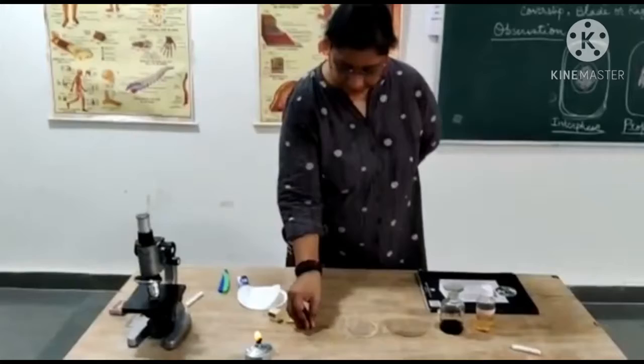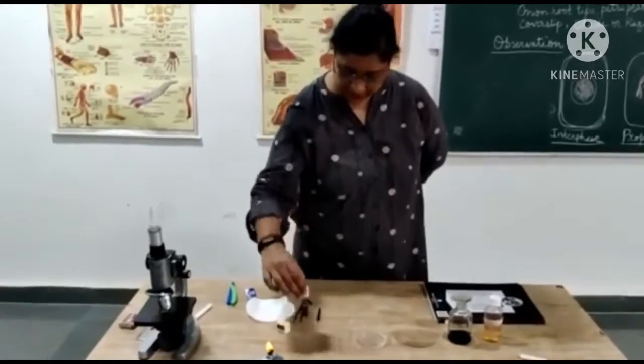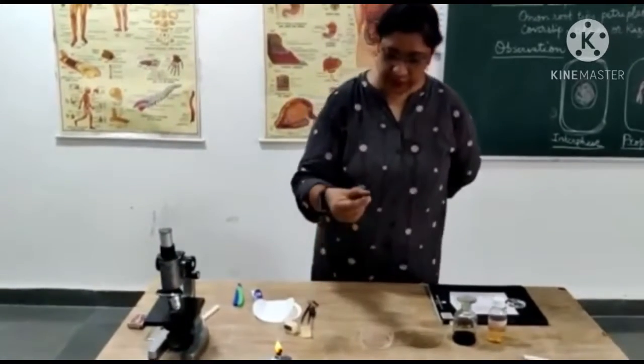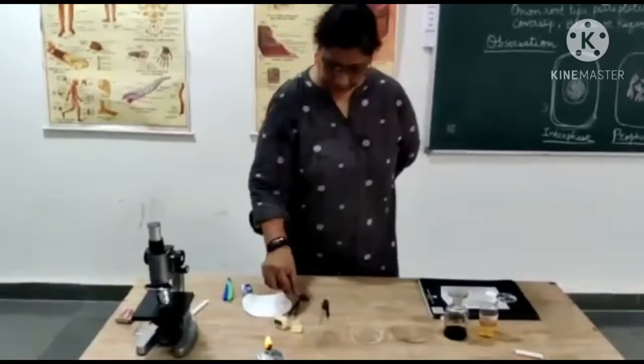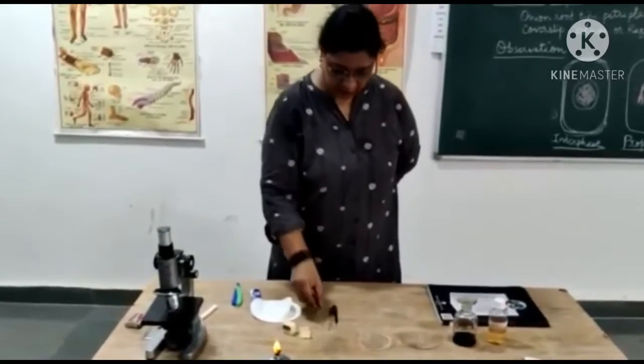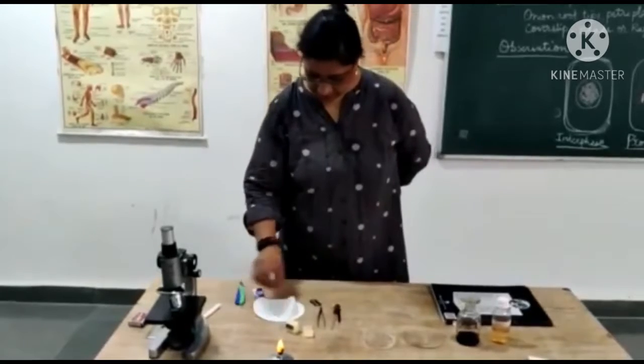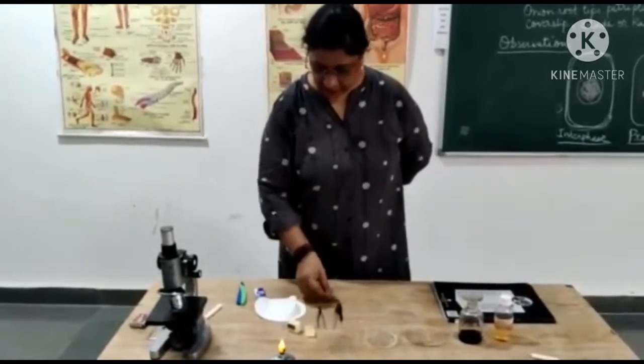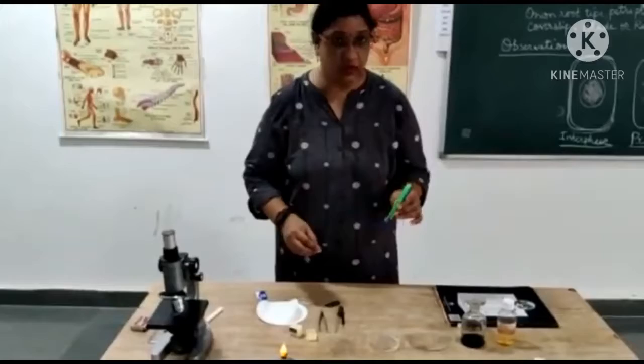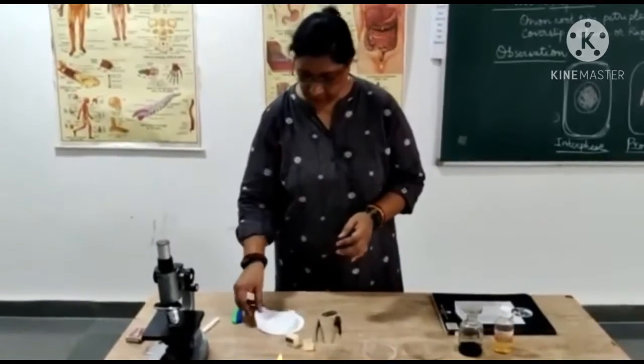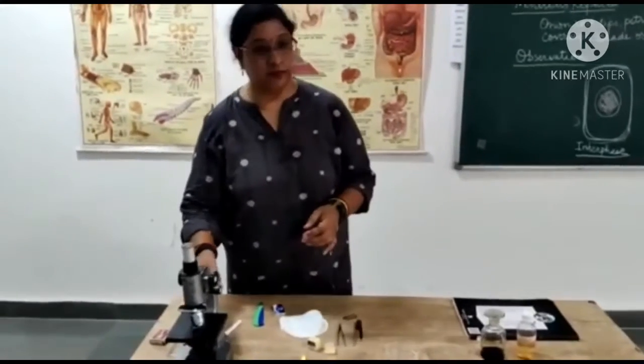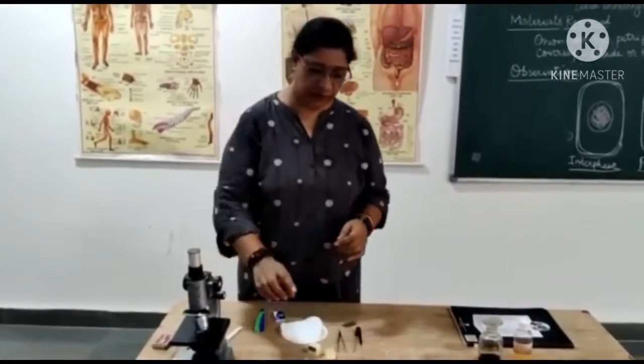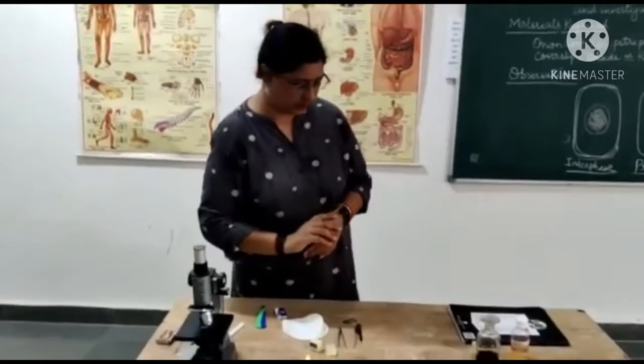Clean slide, cover slip, needle to hold the slide, droppers to take out the stain, forceps to take out the material. We need a blade or razor to cut the section, filter paper to drain the excess stain, one compound microscope, and a spirit lamp for fixation.